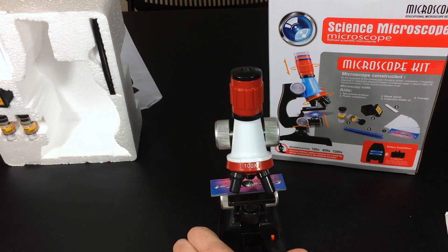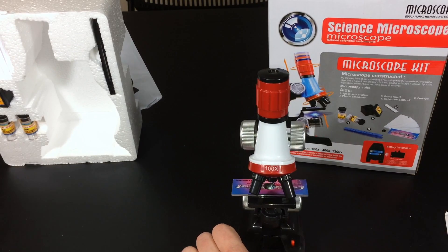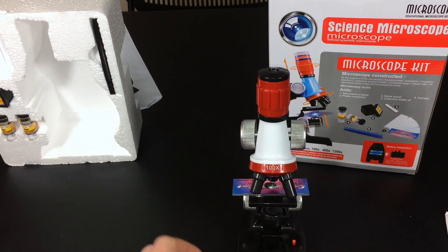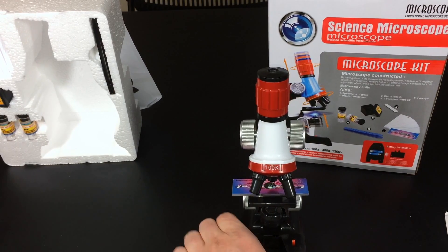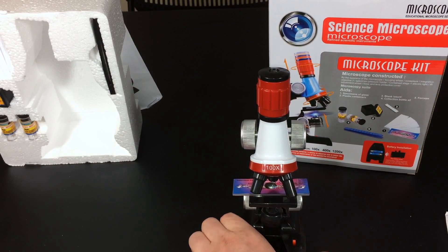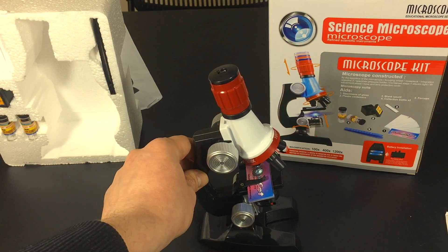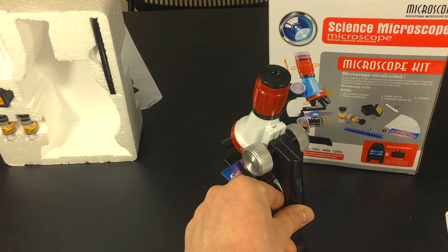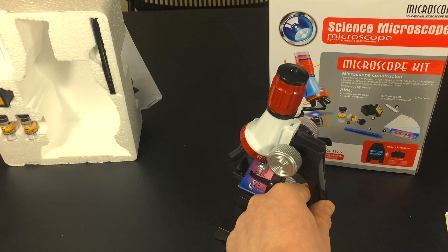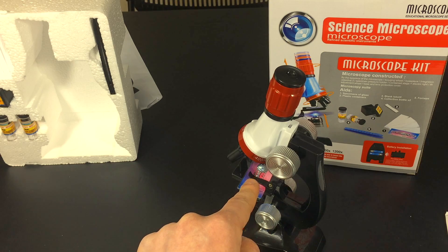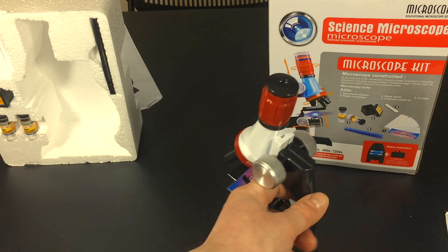Okay, so now I've put it in and I could still see the light kind of shining through right there. Looks pretty cool. We're at a hundred times magnification. We're going to try to see if we could see anything. Okay, so I focused the image off camera here. I had to kind of get it straight. I know that I could definitely see through this diaphragm. We're at a hundred times magnification. I'm going to try to get an actual image here.